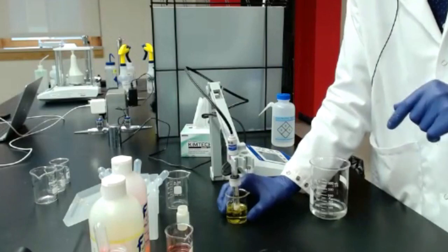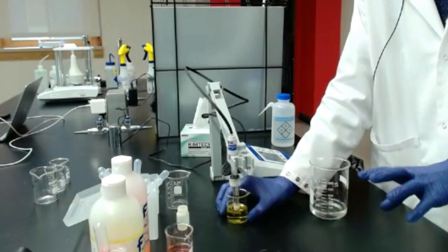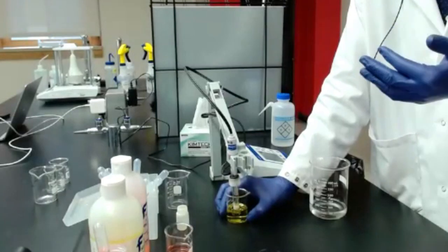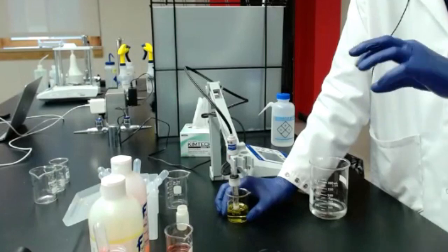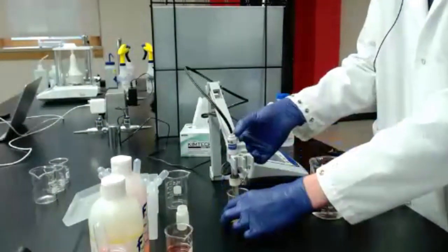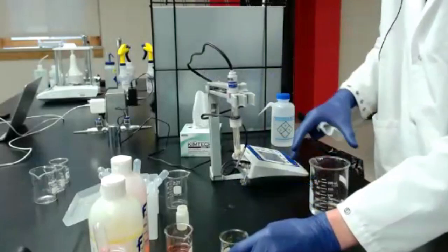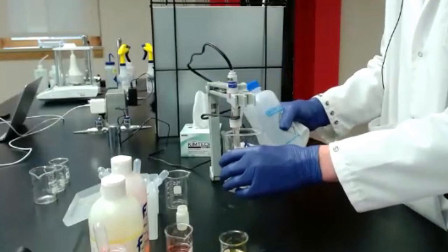So right now my pH meter told me my slope is outside the acceptable range. So it says between 90 and 102%. It's sort of like how well it calibrated, because the computer knows, but the pH probe might not be clean or something like that. It might not be in a good working shape. So I'm going to stop, give it a rinse, and retry that buffer, and we'll see what we get.